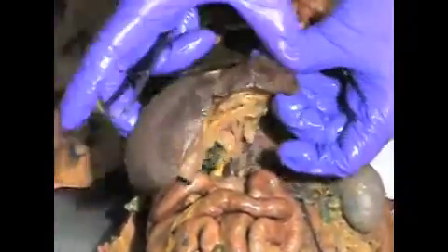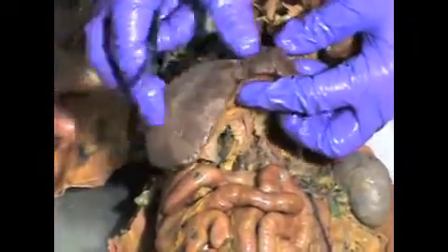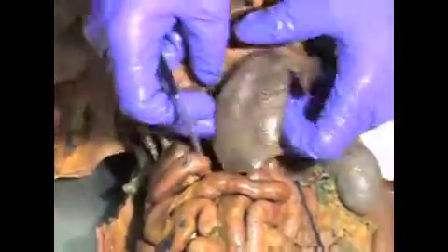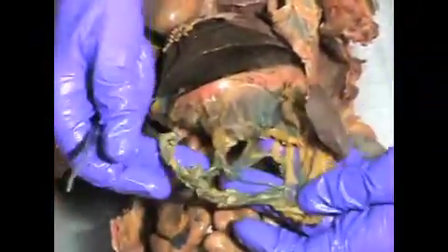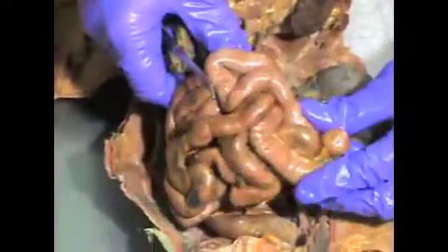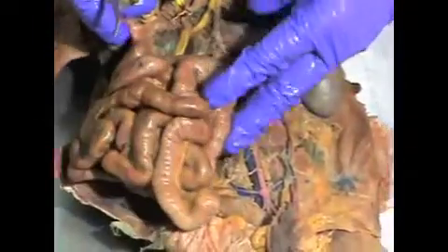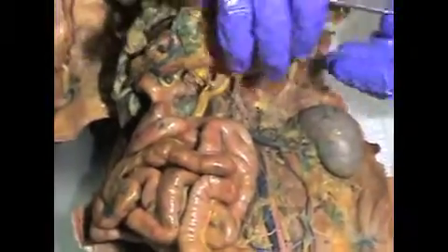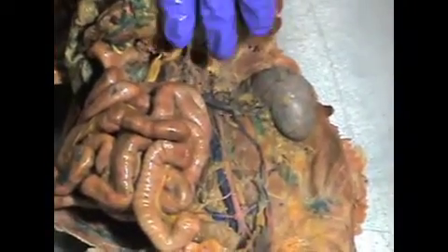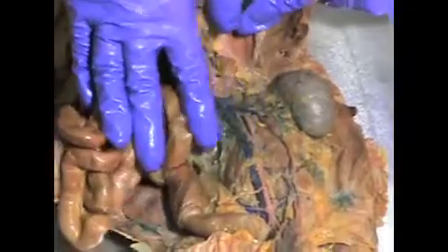And beneath the stomach lies the spleen, this long organ that you see here, served by the splenic artery. Between the spleen and the stomach, there's a lot of adipose tissue, and we will just move that out of our way for now. And we have the small intestine found here, and a little bit later we'll look at where that large intestine is. We're going to push those organs to the cat's right side and look at the organs along the cat's left side.